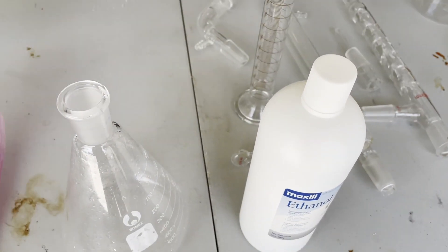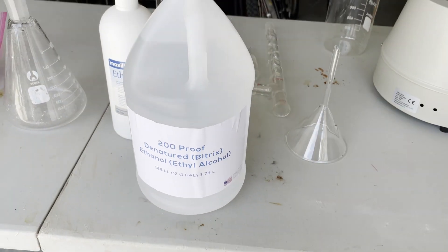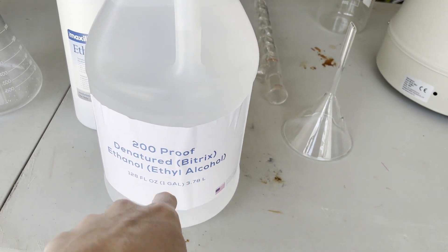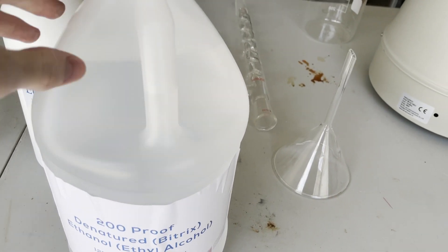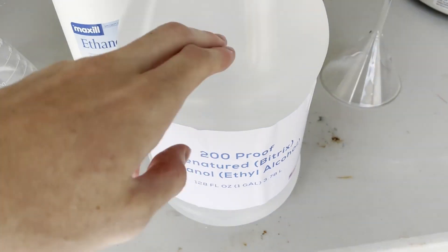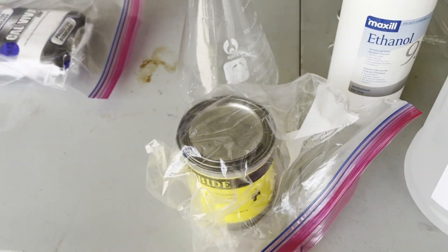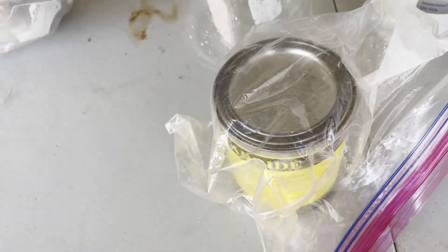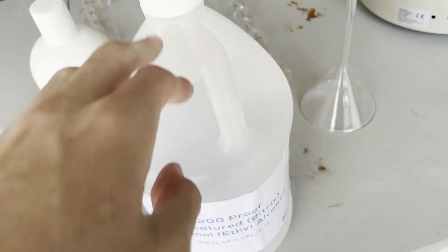So here I bought myself some denatured alcohol, but it's only denatured with denatonium benzoate, so that'll be very easy to remove through a distillation or two. And of course I also need to get rid of all the water and everything else, so I have calcium carbide and calcium oxide, which will help get rid of it.